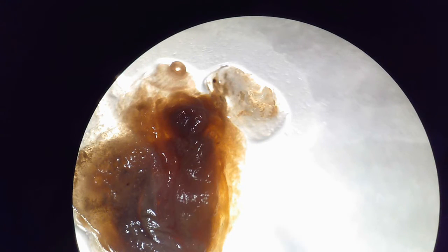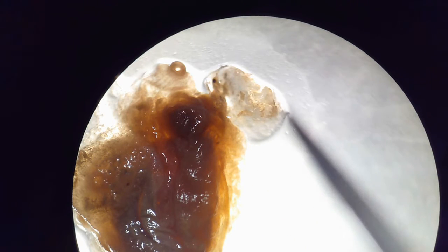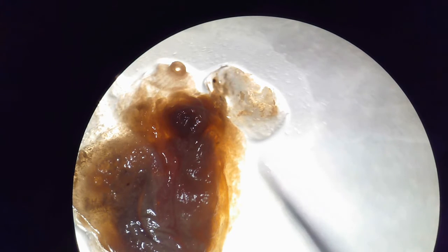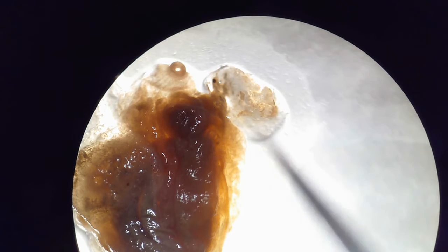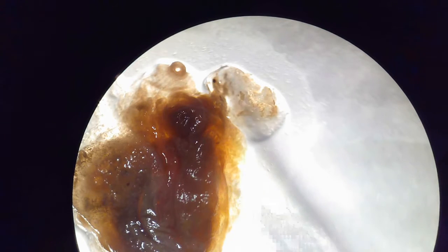So right here is going to be our adult tunicate. What you can tell right away is this right here. That's going to be our tunic. That was also seen in the larval stage of the sea squirt. But for the purpose of this dissection, it was cut off and moved to the side to look at the more internal structures of the sea squirt.